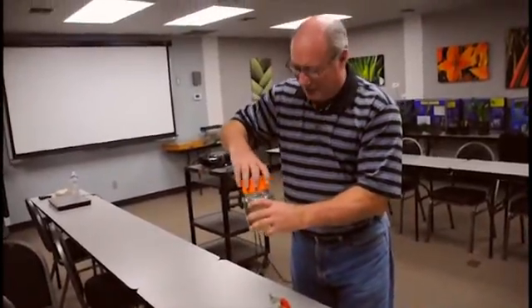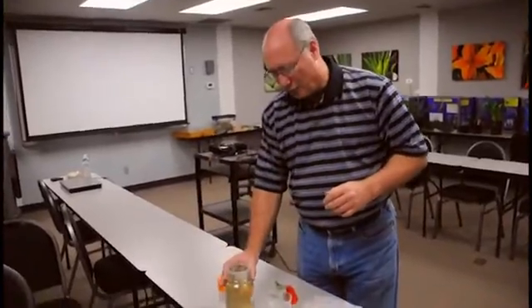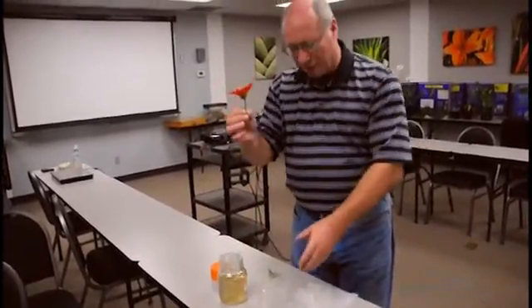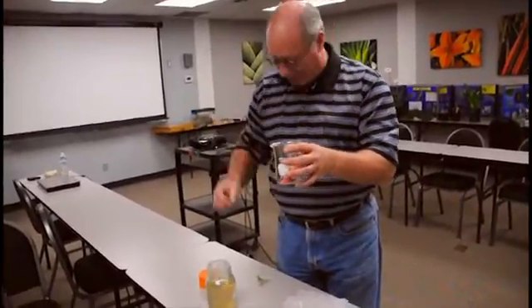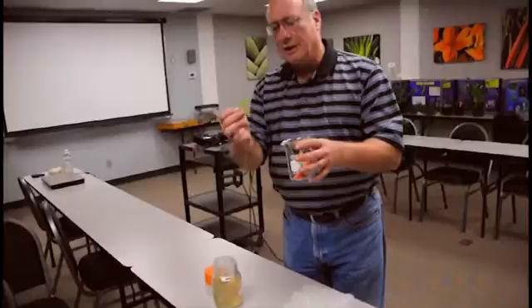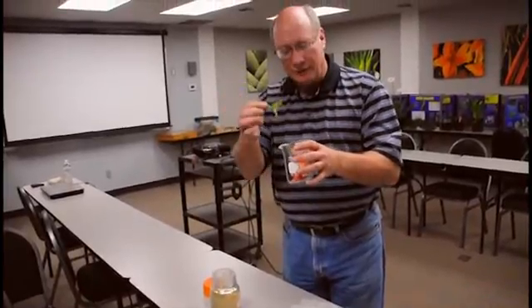Now ethanol is a little different, it's not the alcohol you typically get in the stores, but it is one that you can use. So for instance, we're going to put a gerbera flower in there and there's some thrips in that flower. You could also put in something like this little terminal of rose and it has some aphids and things on it.